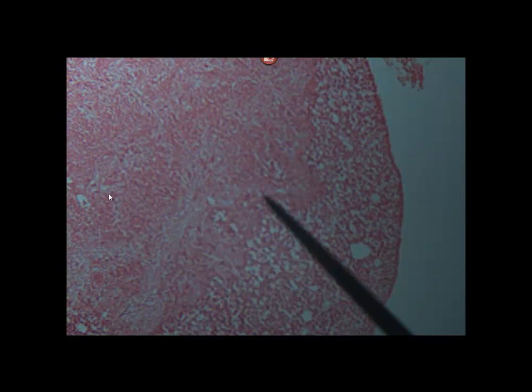Anyway, you can't really see cell bodies, but this is all neural tissue. You can see how it's more dense. I'm going to go one more. So over here, more nuclei of pituocytes, and anyway, it's neural tissue.